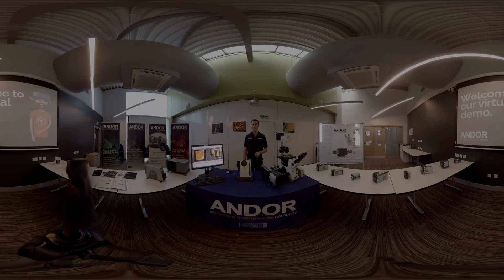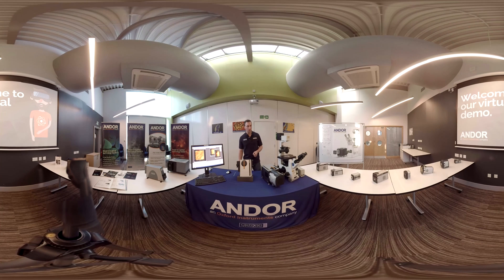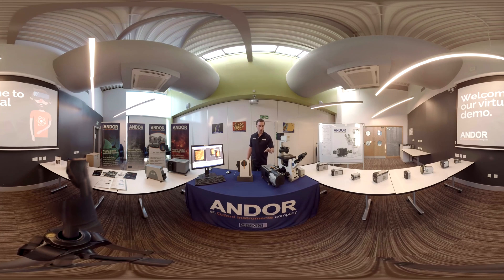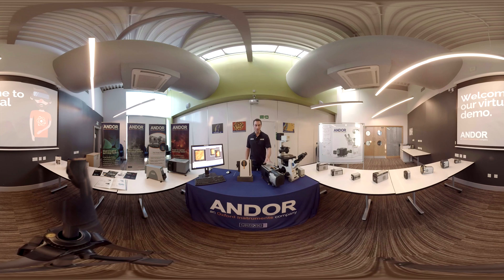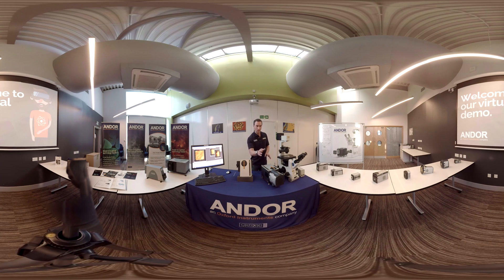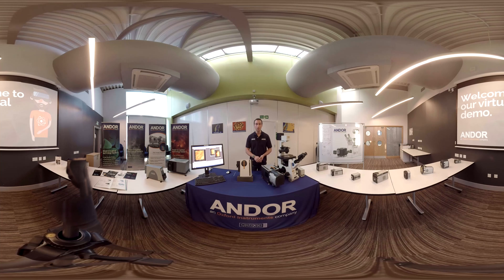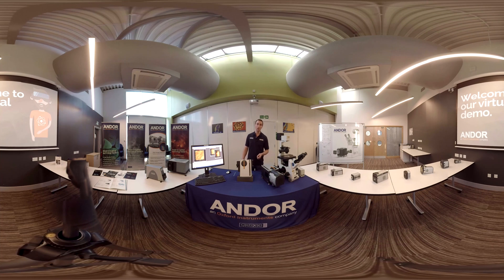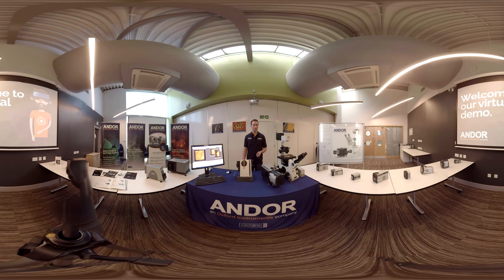Hello and welcome to Andor's virtual demo of the Shamrock 193. My name is Tristan and I was the optical engineer on the project. I was tasked with creating the smallest spectrograph which is automated and can take two cameras on the exit ports. The resultant focal length of the system was 193mm, hence the name.